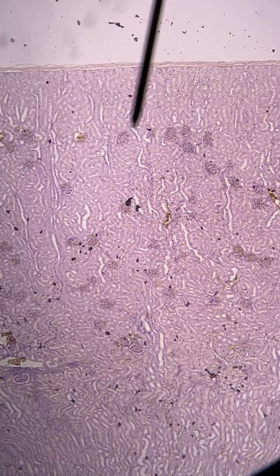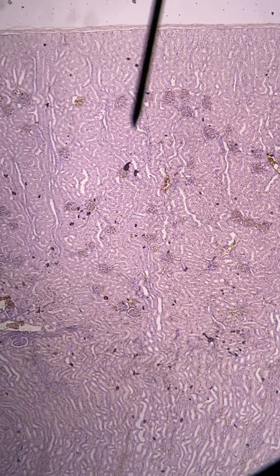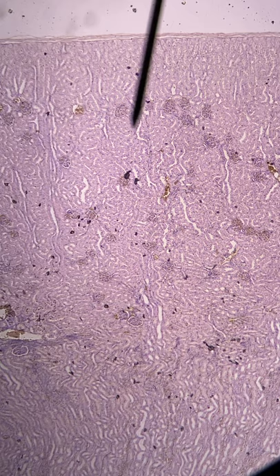This is video six, if I'm counting correctly. We've got a microscope slide here of a section through a kidney. This is on lowest power, so a total of 40 times magnification.